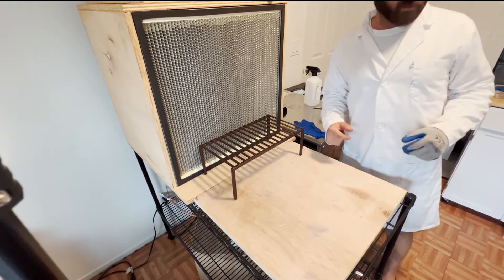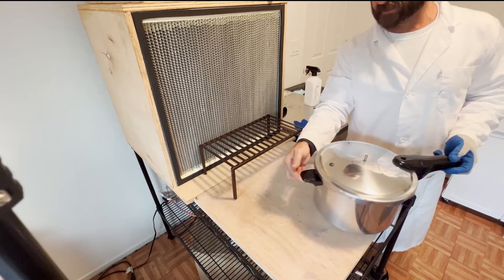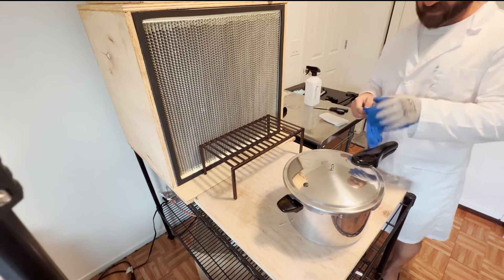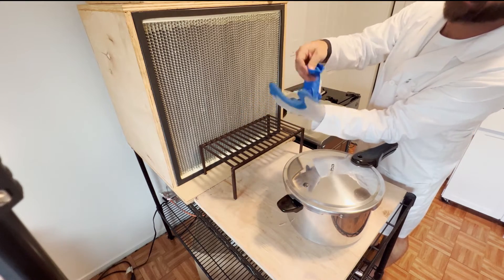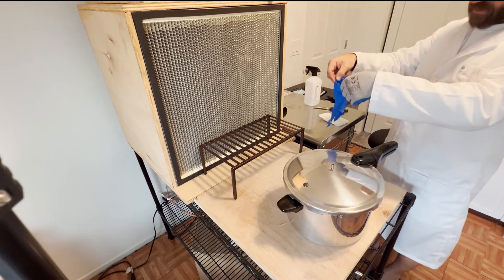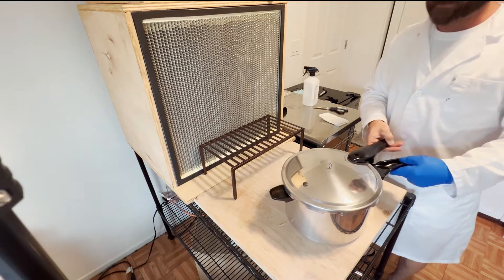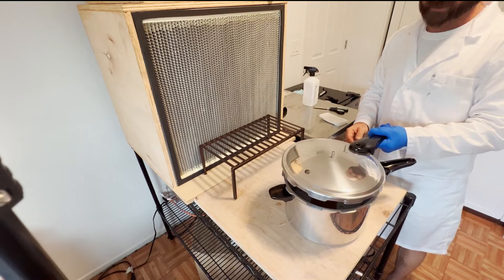I brought the pot out and I've already sterilized the surface before we started. I've got a thick rubber glove on with a rubber coating. What I like to do before I handle the agar is put another rubber glove on over top of it — the contours make it really difficult to keep clean with alcohol. We're in the clean flow hood, so I can take the lid off without any contaminants getting in.